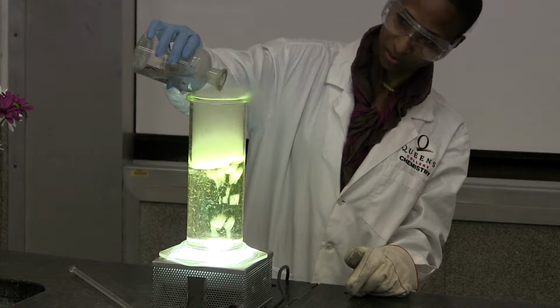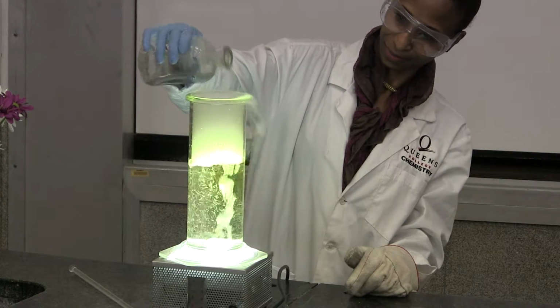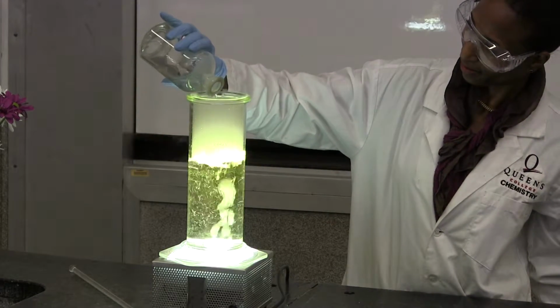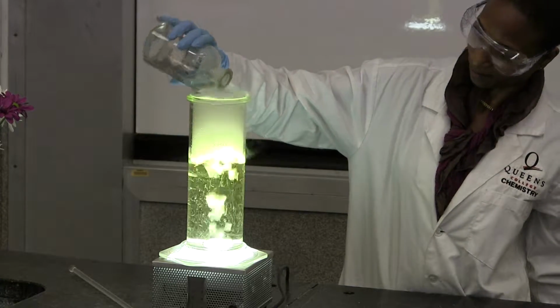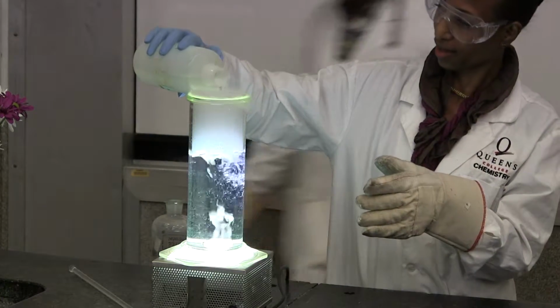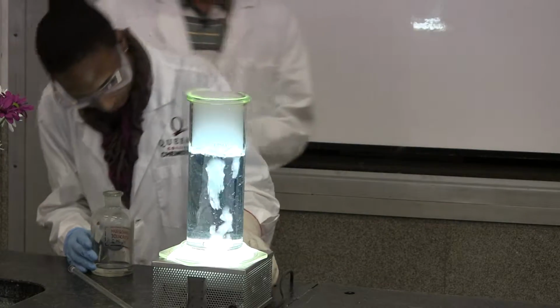I'm going to pour the whole bottle here, guys. We want our blue back. Blue. Okay, we're going to get it. We're getting the blue. Maybe we need something more concentrated here. Let's see. Needed something a little more concentrated. Yes, thank you. So there you go, rainbow based on pH.